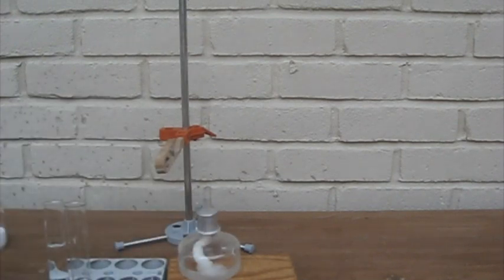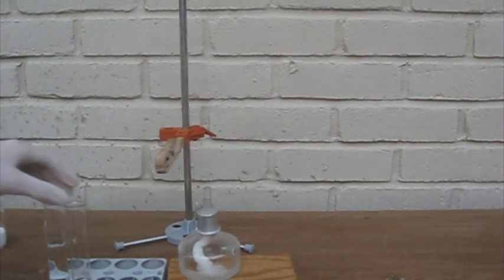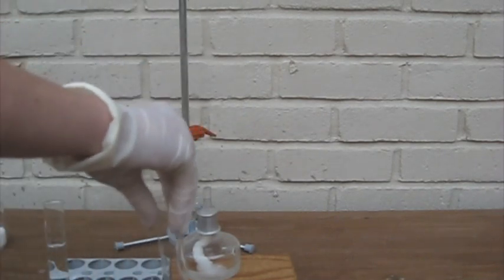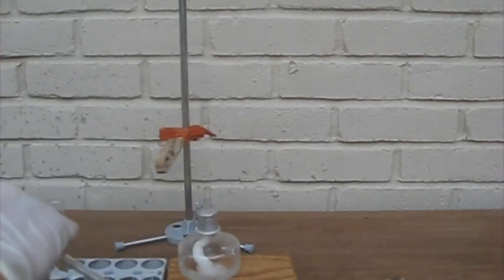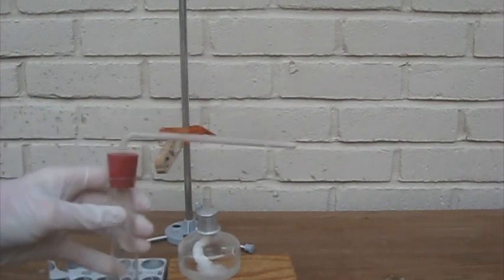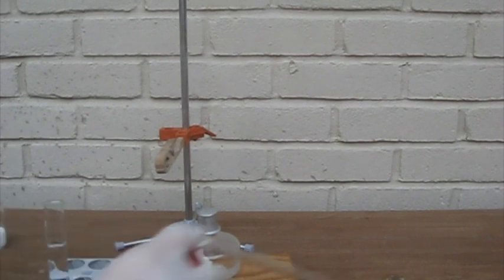Now that I've added the sodium hydrogen sulfate and sodium chloride to the test tube, I'm going to mix the two. To get best results of hydrochloric acid, make sure that the two salts are thoroughly mixed.